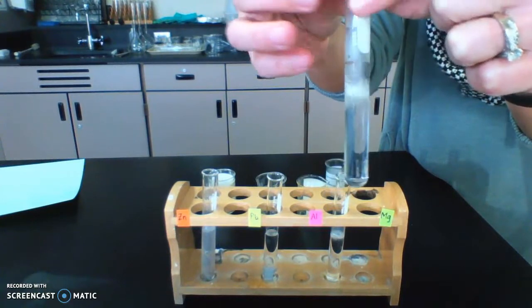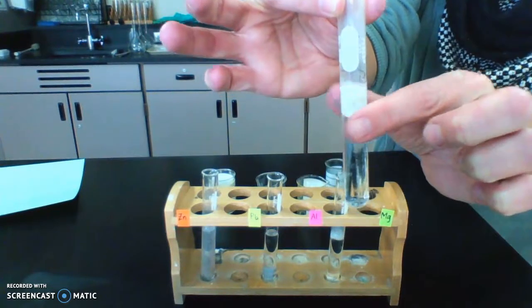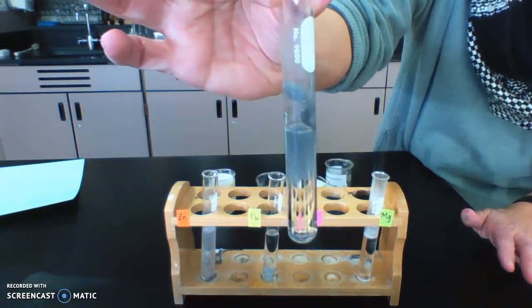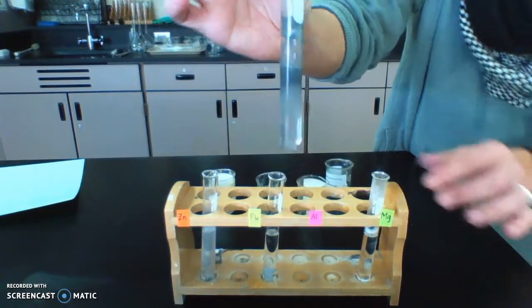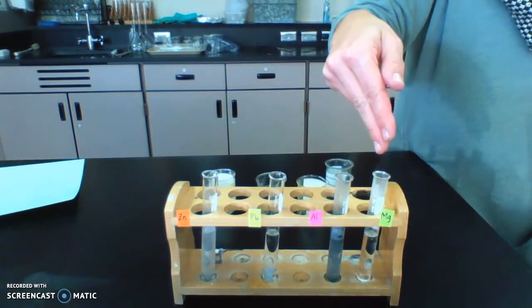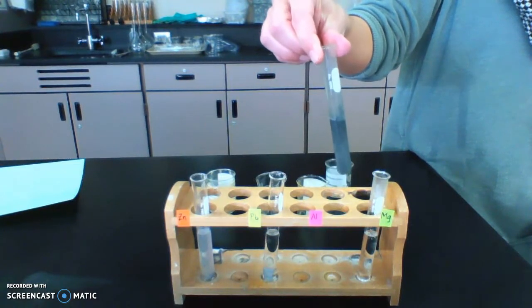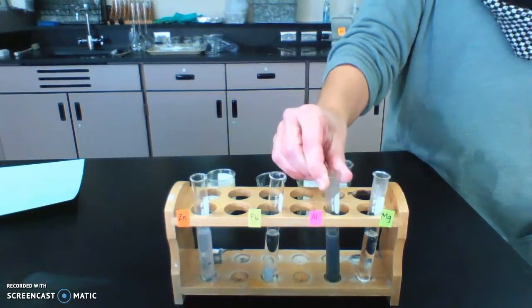Oh, immediately. So this one was immediate. And this one is, oh, it's really hot right away. So the zinc took a little bit longer to get going, but it still reacted fairly quickly. Oh, we've got our aluminum reacting now, so that took a little bit, but it's happening. Okay. So magnesium reacted first, right away, immediately. Zinc was next, quickest. And then the aluminum took a while longer, but then did react. All right, and it's done already, but the pieces were not identical sizes.